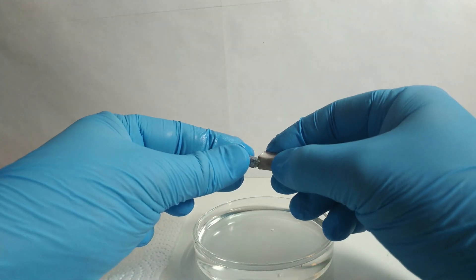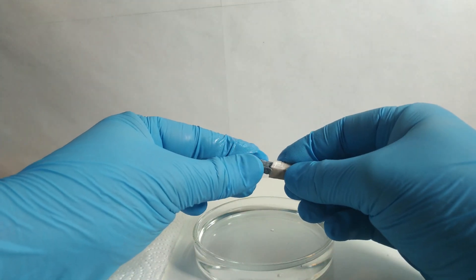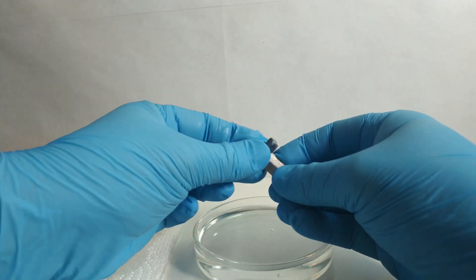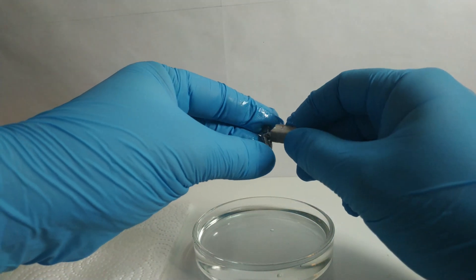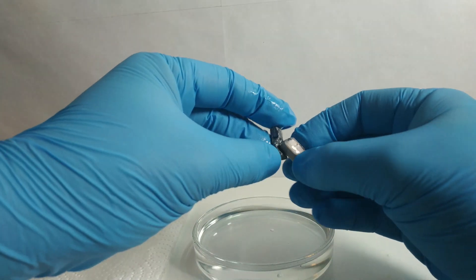The liquid in the Petri dish is paraffinum liquidum as an inert protection. At first glance, not much is happening except for the deformation of the very soft potassium. But after a few tries we notice that there is a liquid part.